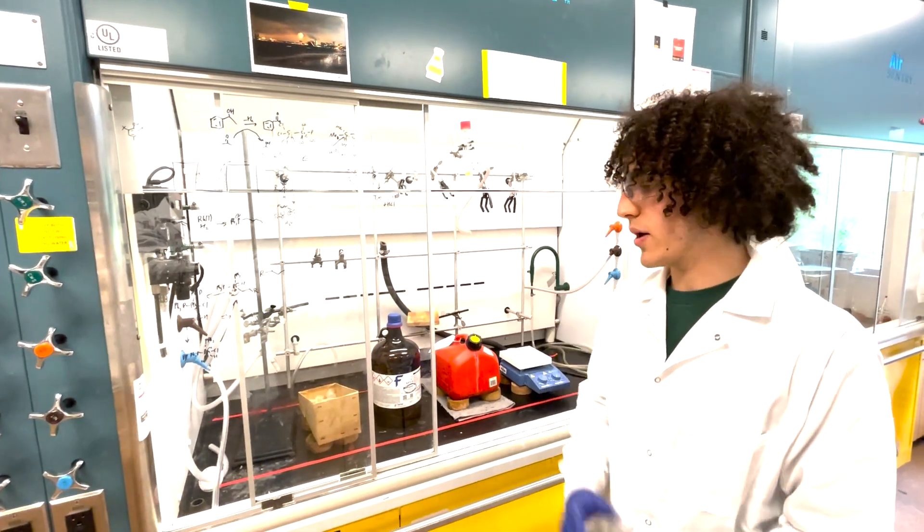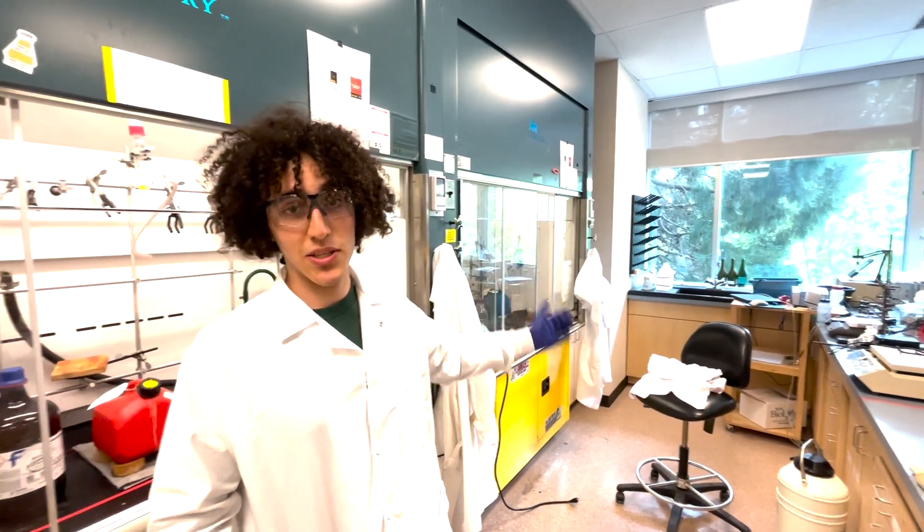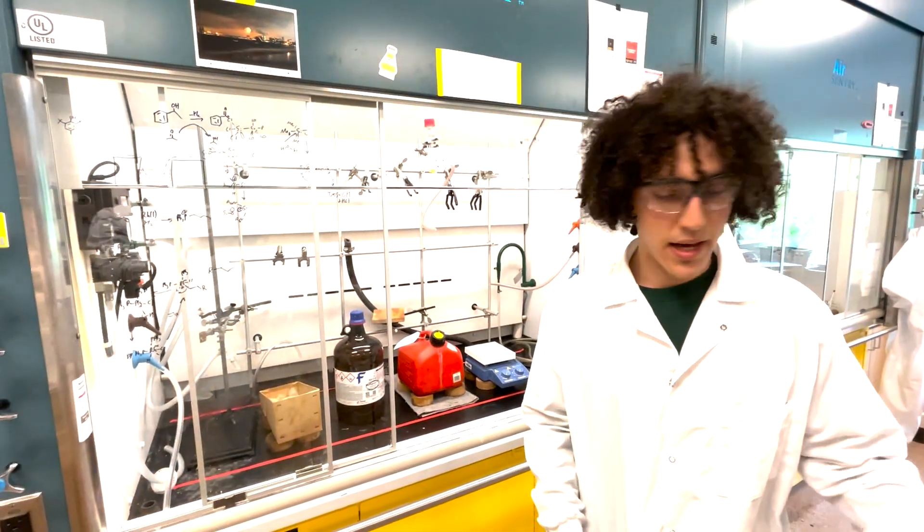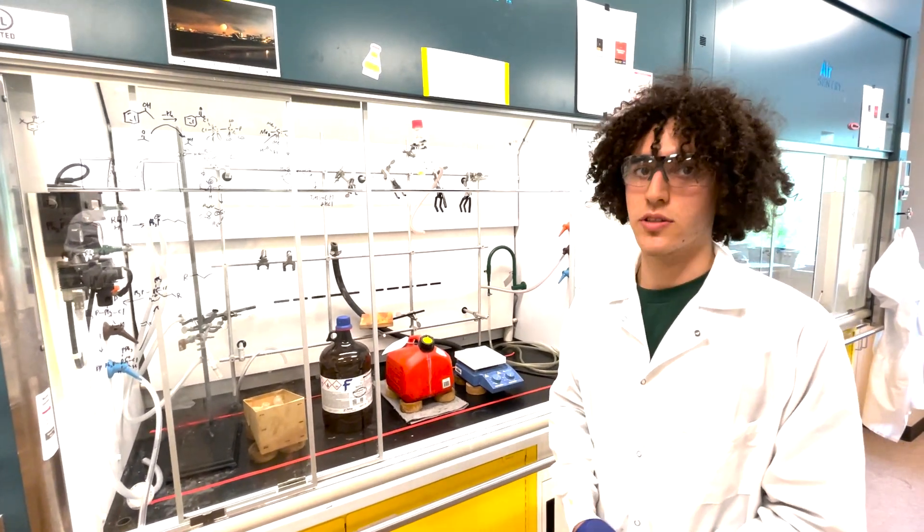Another note is to think about the environment. If there is an open window, in this case we don't have one, or a fan, that can also introduce turbulence which will allow vapors to spill over the edge.